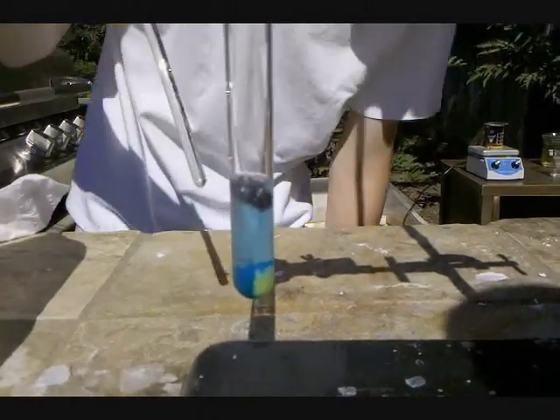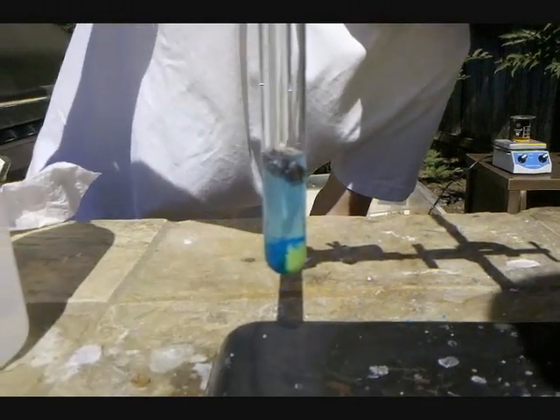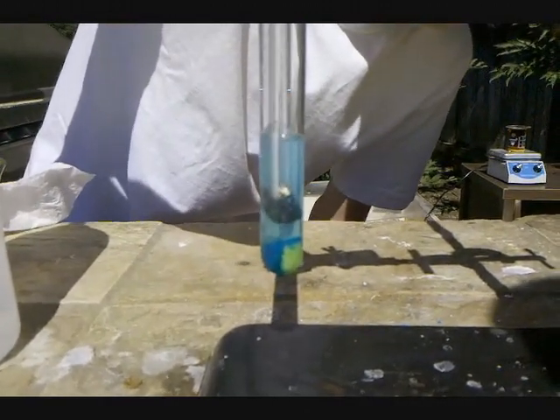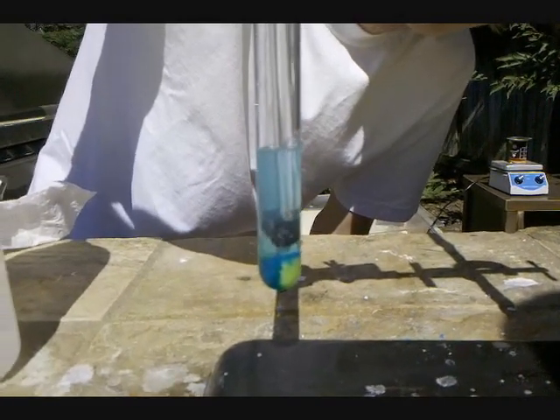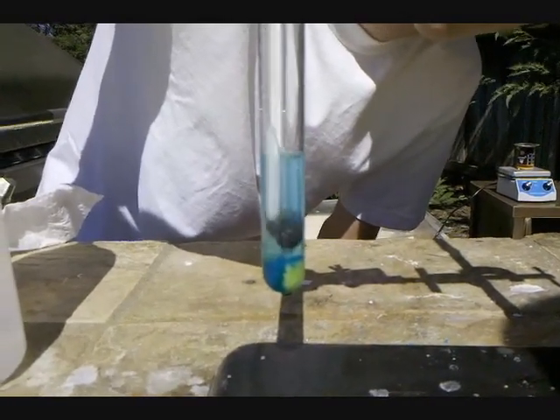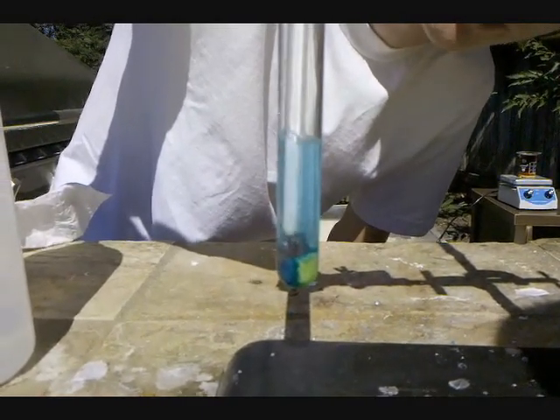Now, since some of the sodium chloride and copper sulfate has been dissolved, you can see the aluminum is reacting. The dark stuff formed on the surface is copper metal, and the bubbles you can see are hydrogen from aluminum's reaction with water. If I push it closer to the ions, you can see the vigor of the reaction increases.